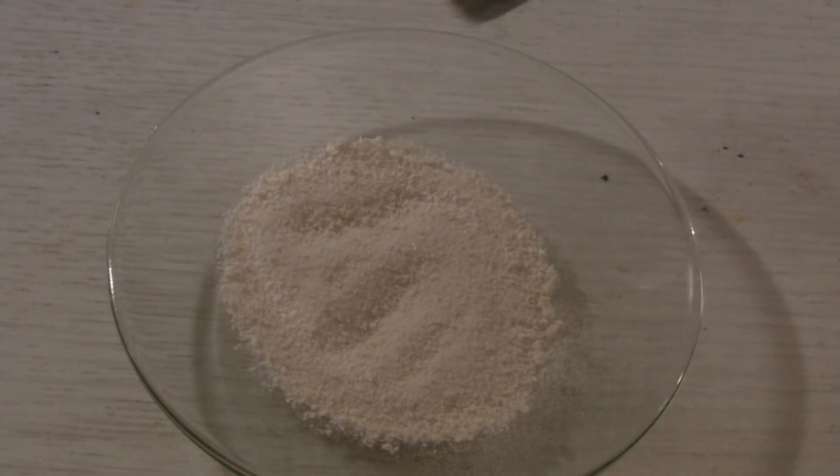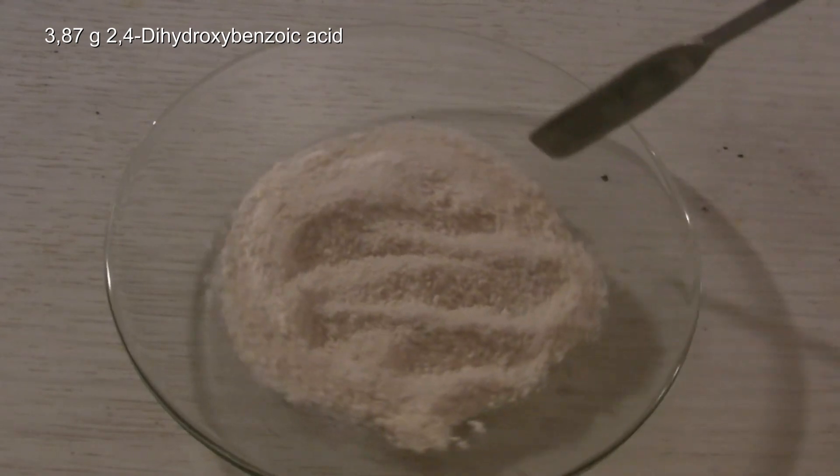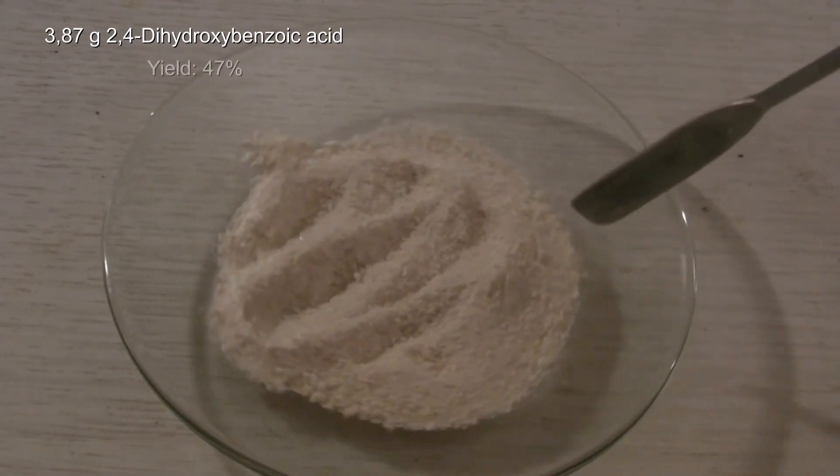After drying it again, 3.87 g of 2,4-dihydroxybenzoic acid were obtained, which corresponds to a yield of 47%.